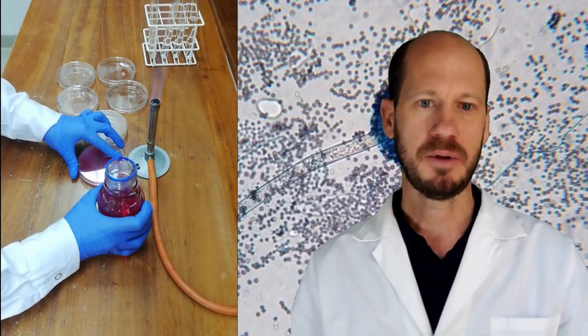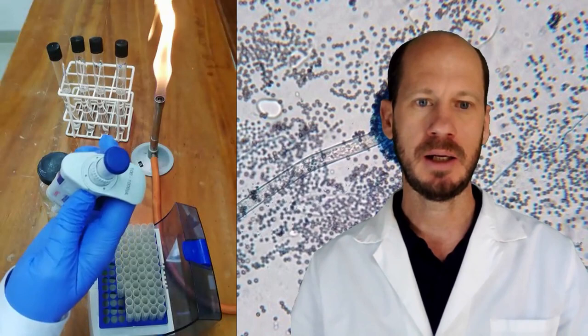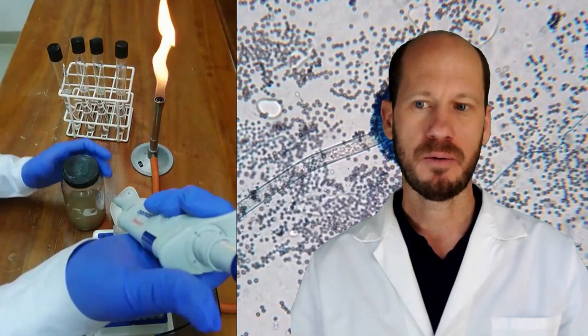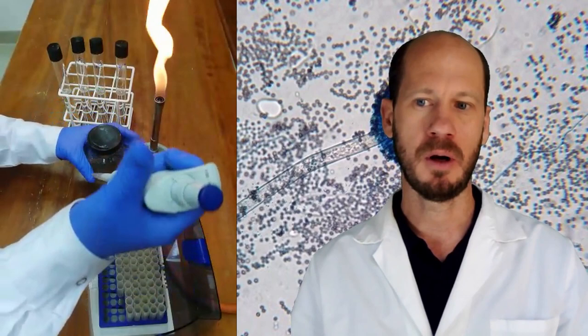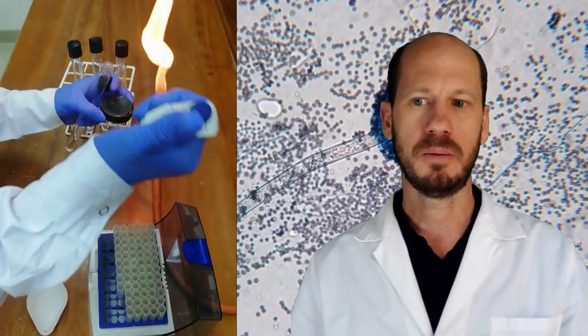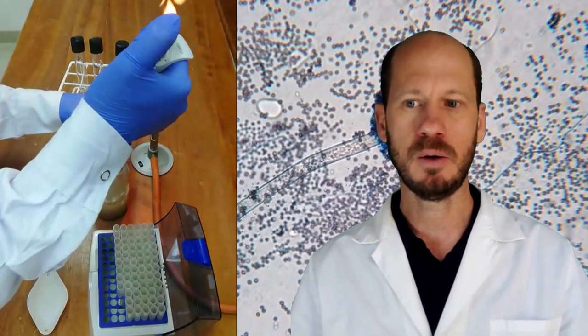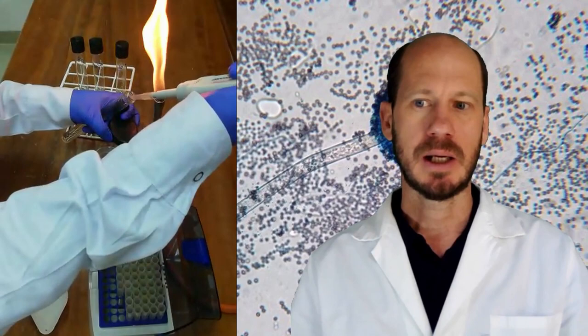After the preparation of the medium we will move to prepare the serial dilutions of soils. We will weigh 10 grams of fresh soil in a bottle of 95 mL of 50 millimolar sodium chloride. The reason we use 50 millimolar sodium chloride is to avoid osmotic stress that would kill some of the cells from the soil. We will shake well this soil with the water and allow the soil to settle on the bottom. Then we will take 2 mL of the remaining suspension and transfer it to a new bottle containing 18 mL of the saline solution, which we will call bottle B.